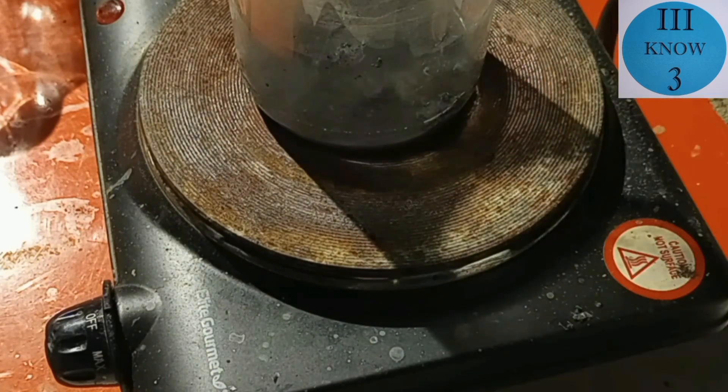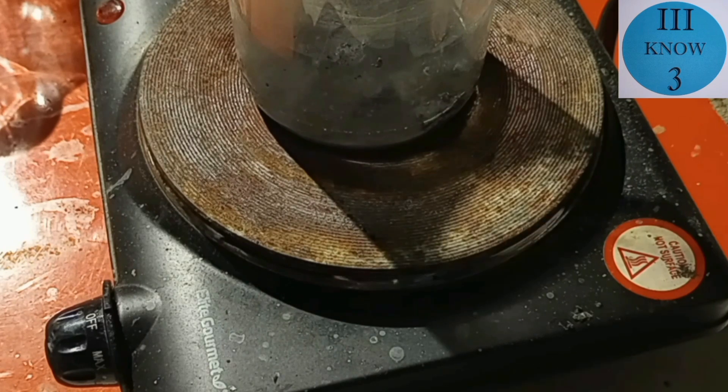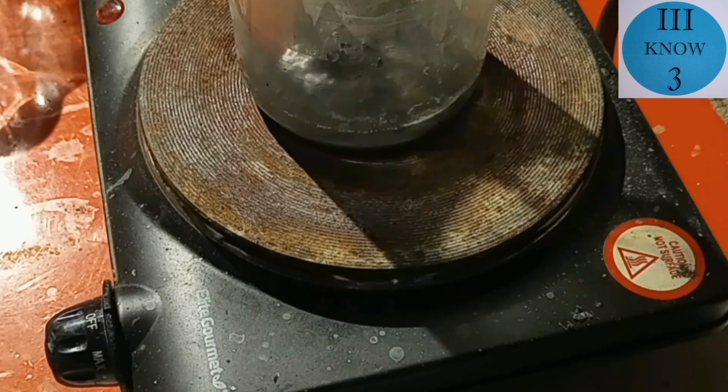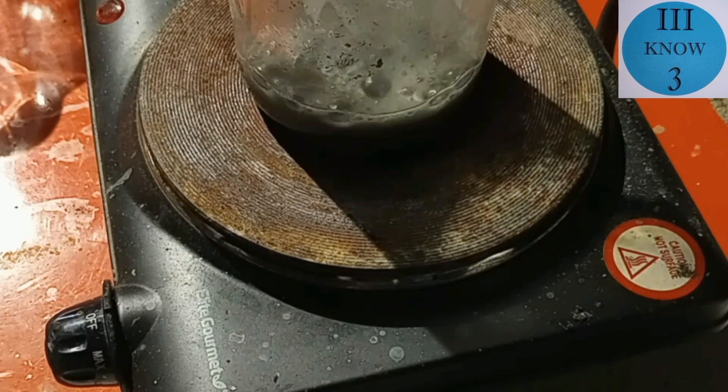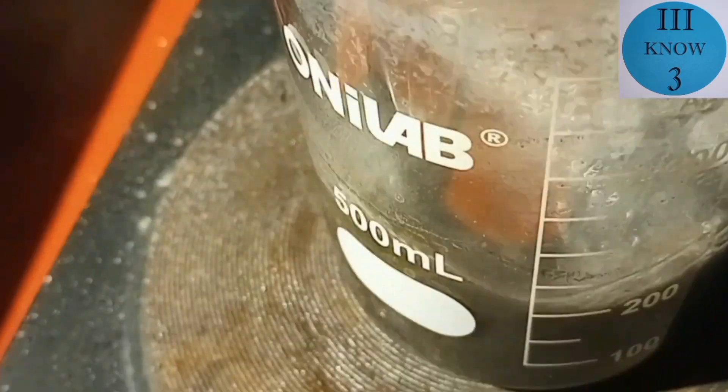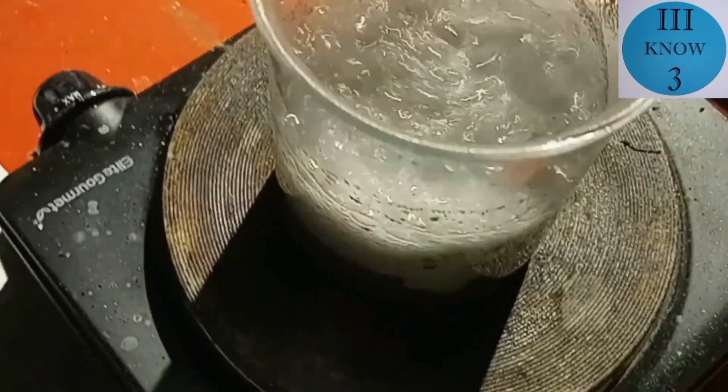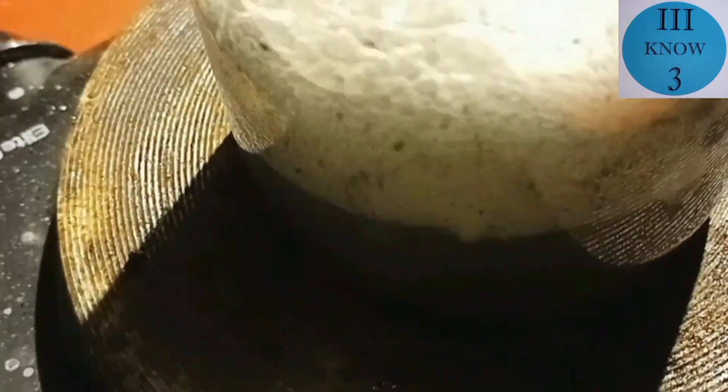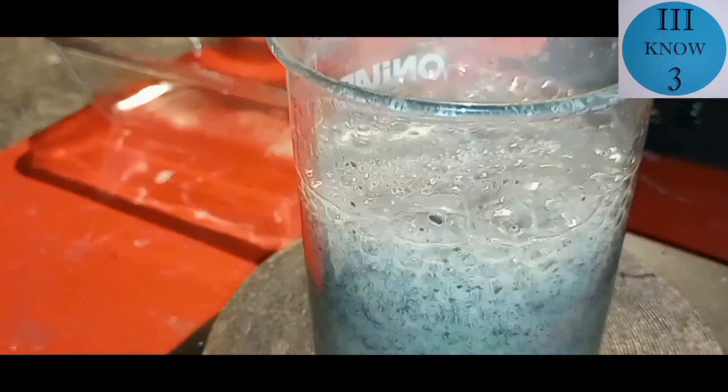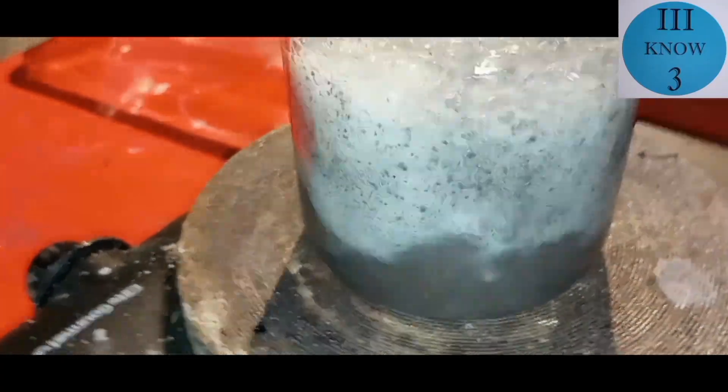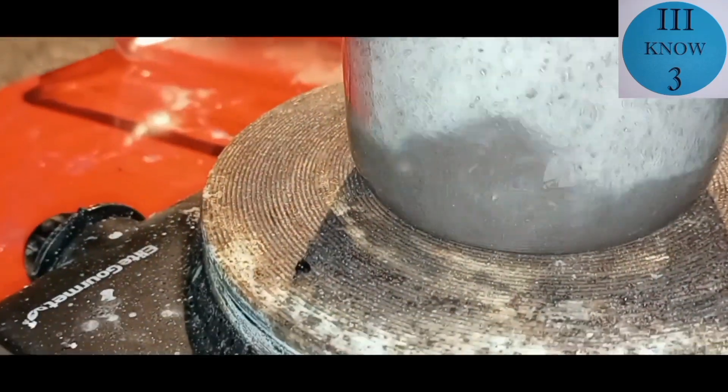And we will add some muriatic or hydrochloric acid. The idea here is that the hydrochloric acid will dissolve the zinc and the nickel but it should leave behind some really clean copper. We have a really good reaction going here as the zinc is getting violently dissolved.